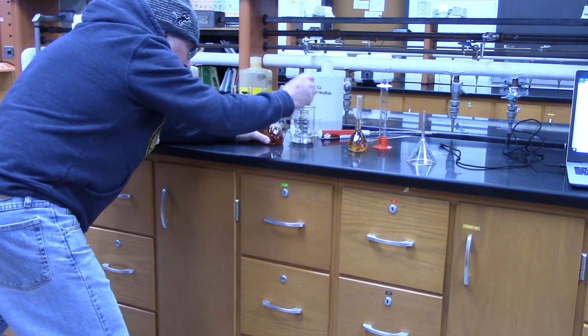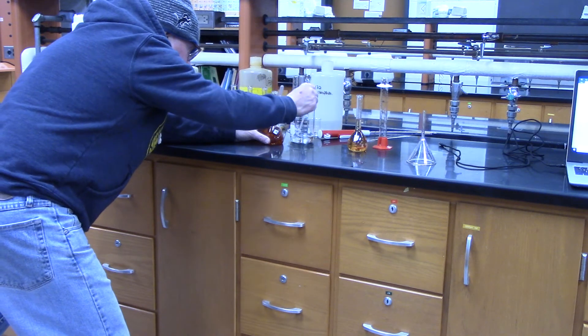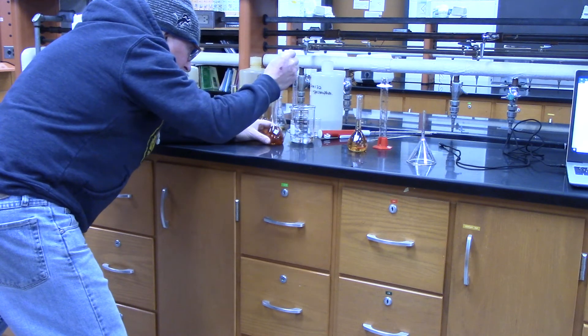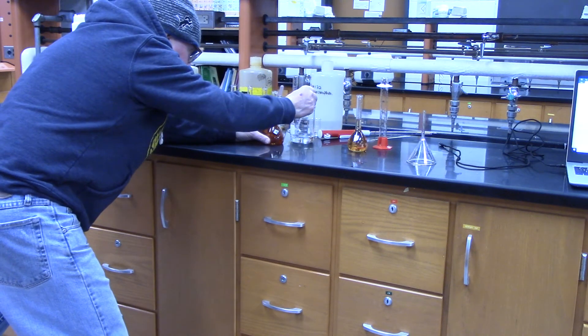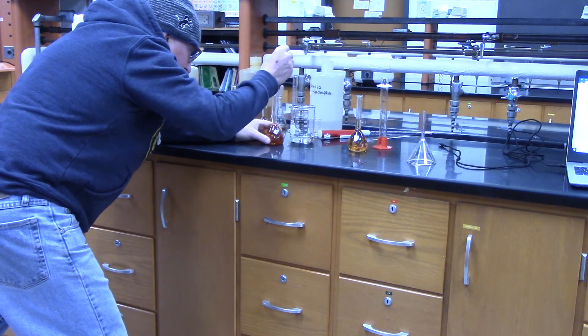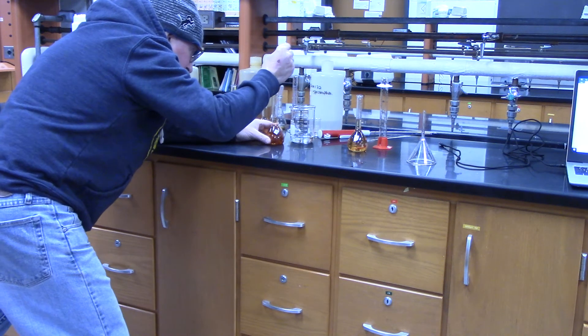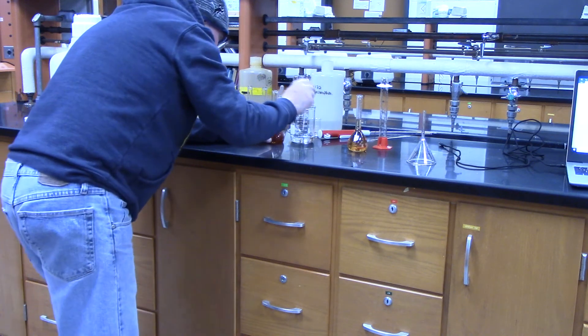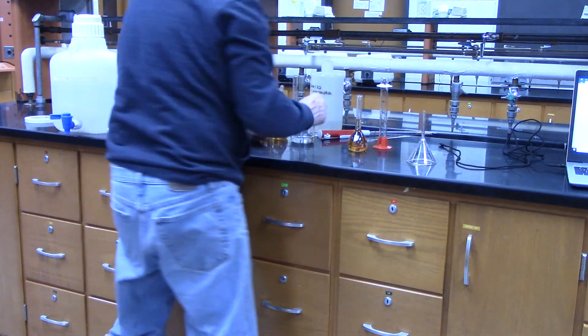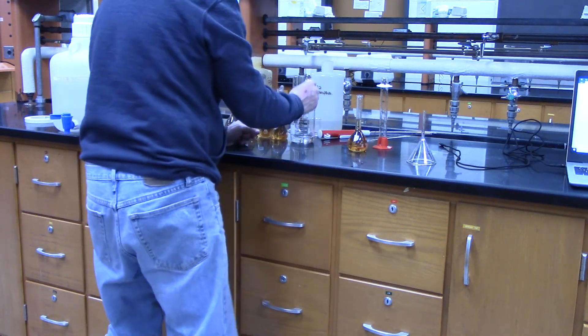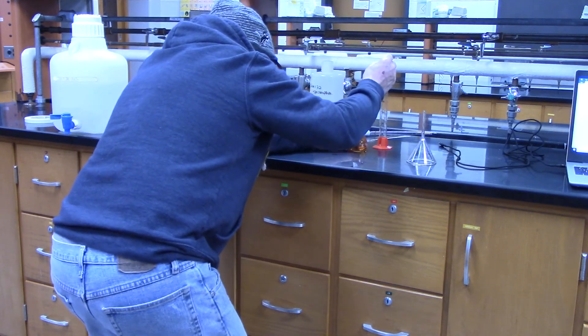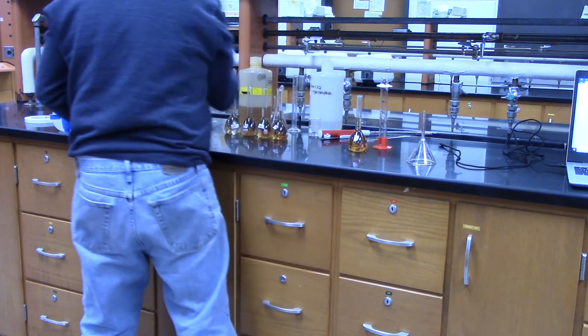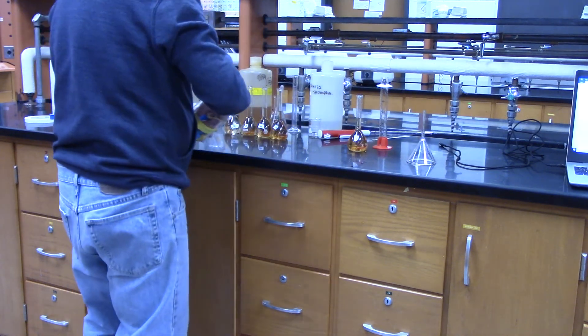So, number four and five, I'm just going to use the pipette. Number four is going to take a little bit of water, because I have to add up to 10 mils. And then number five is just basically topping it off. Okay, there we go.